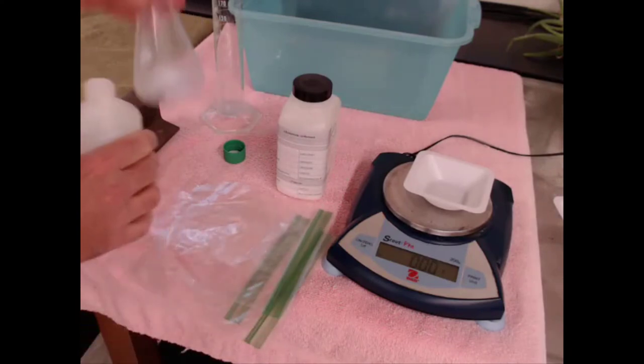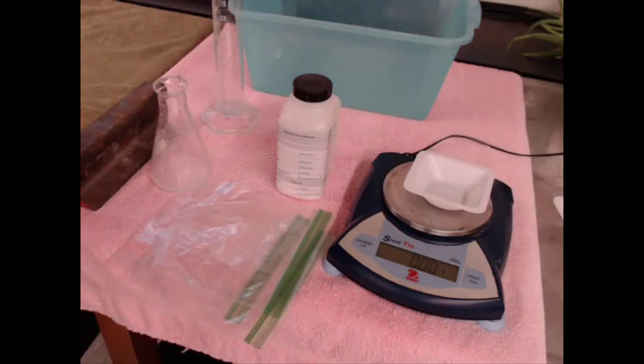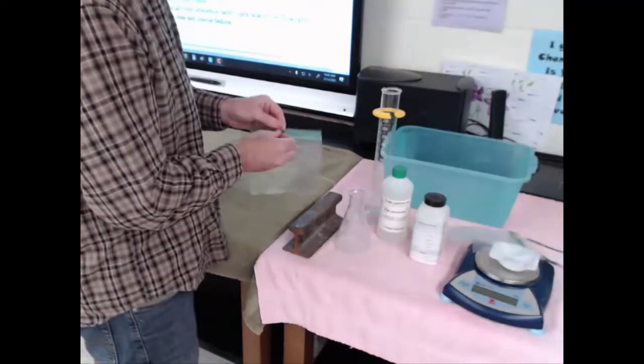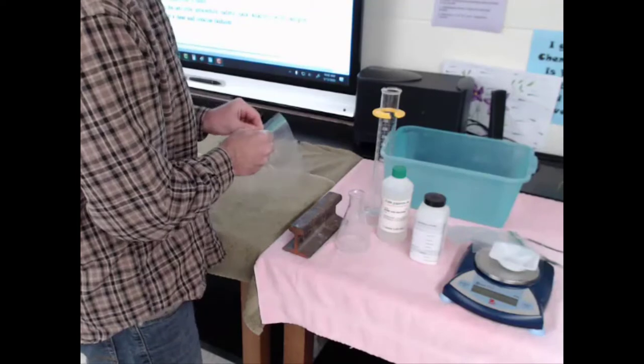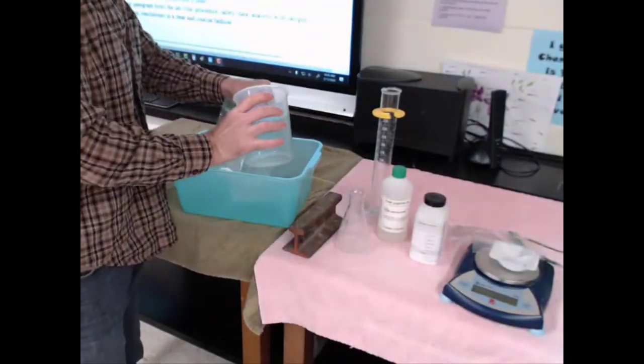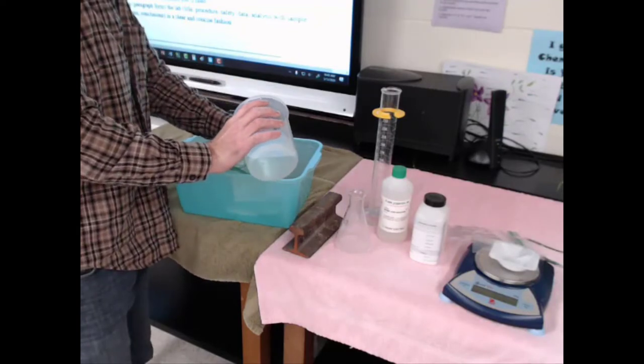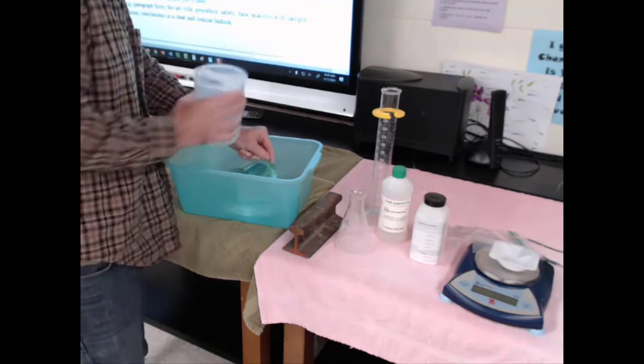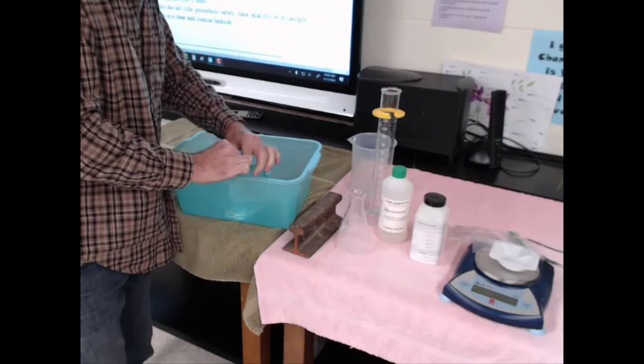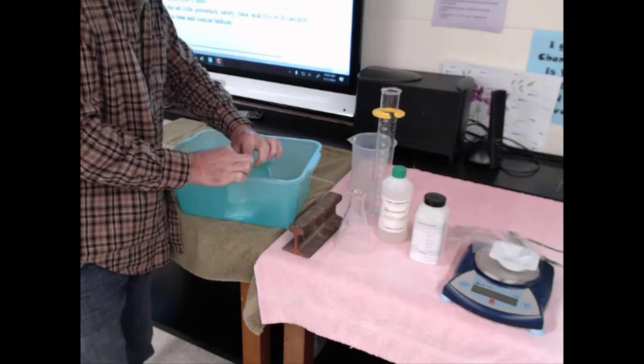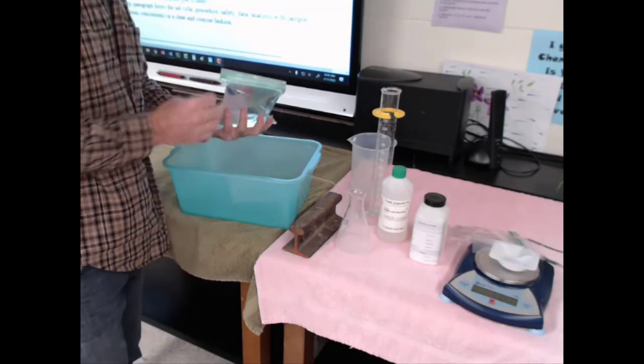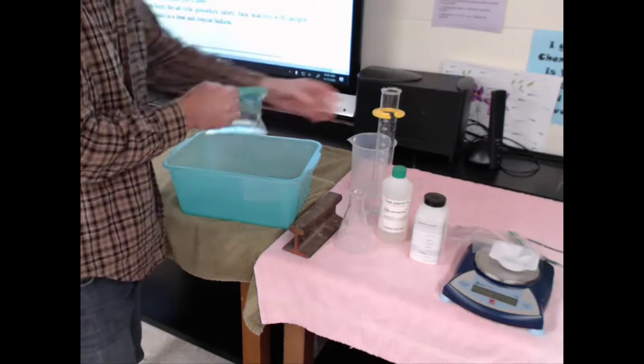The first thing I need to figure out is how big are the bags. I'll just open one up and add water until it's totally full. I'm just trying to figure out how big the bag is. I suppose I could look it up on the box, but that probably works with English units, not metric units.